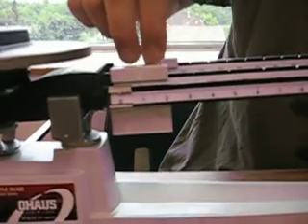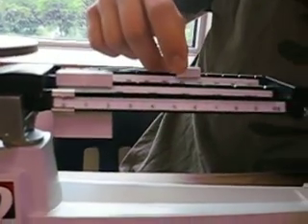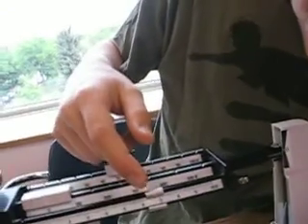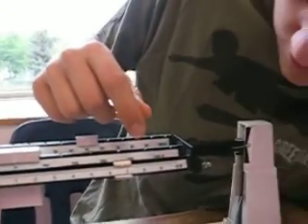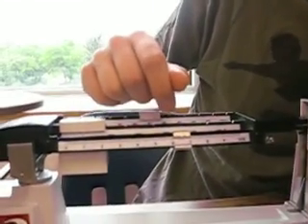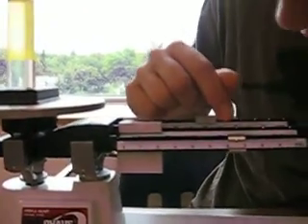I'm thinking just move this forward until it goes down. Move back to 50. So that's about 56.5 grams. We add that to our chart — 56.5 grams.